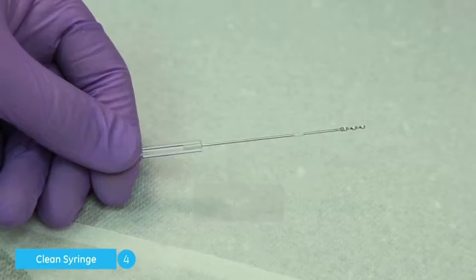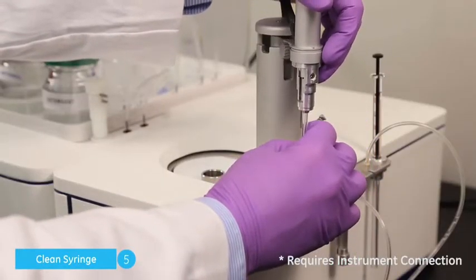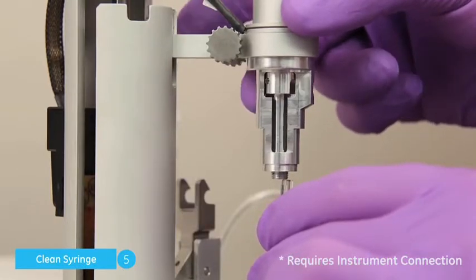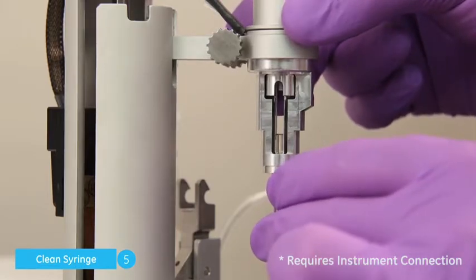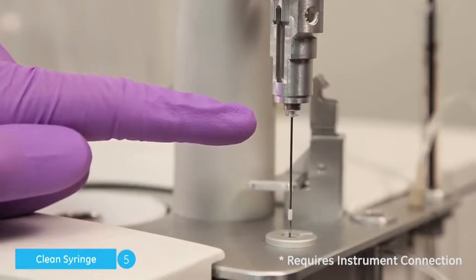Click Next. Gently insert the syringe glass into the pipette housing with the syringe's fill port facing the same direction as the hole in the pipette's rotating assembly. If aligned properly, the installed syringe glass should leave about two millimeters of glass exposed.